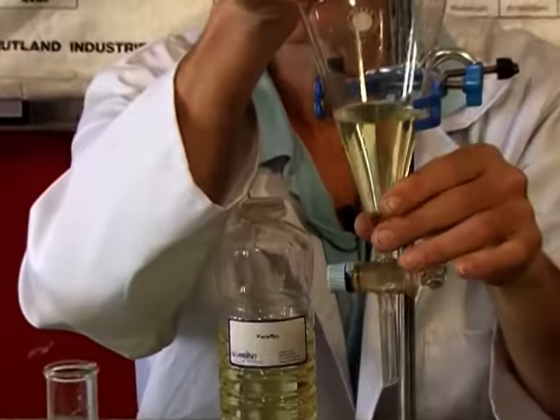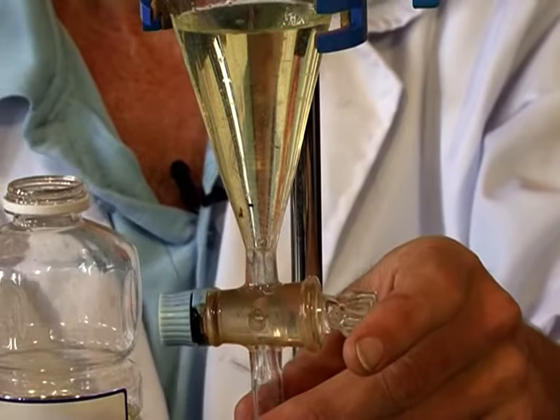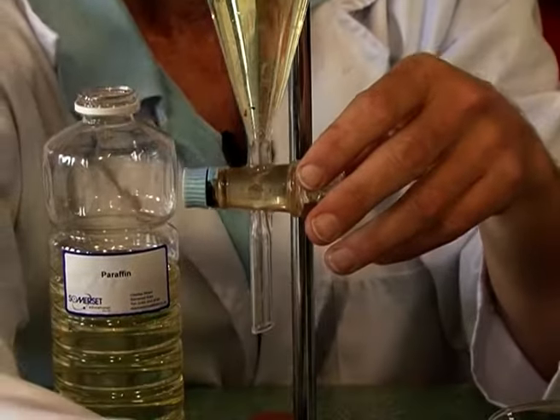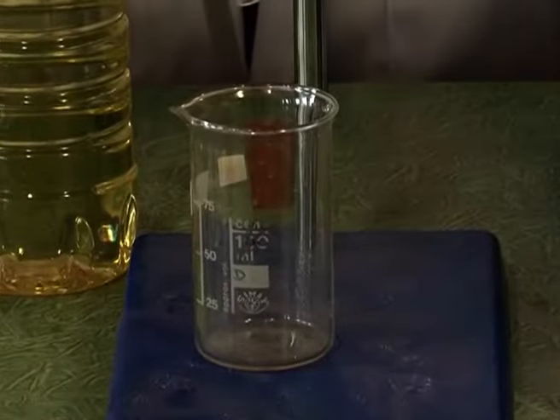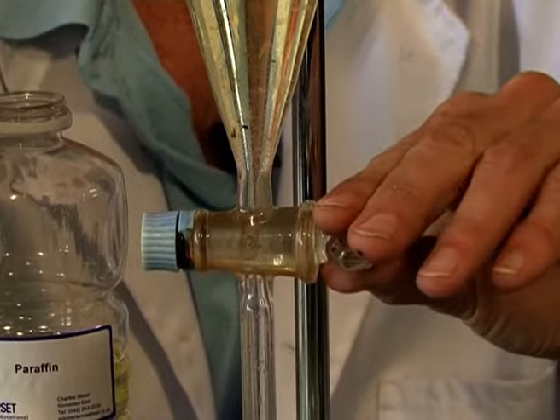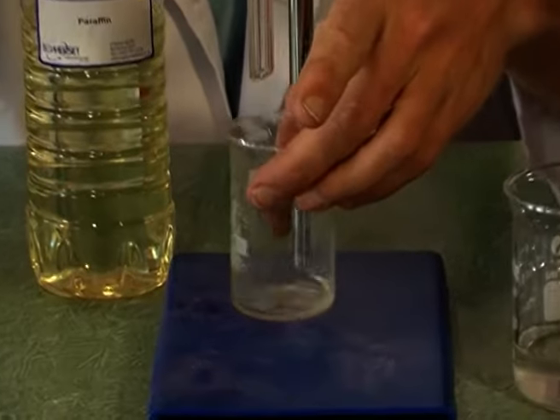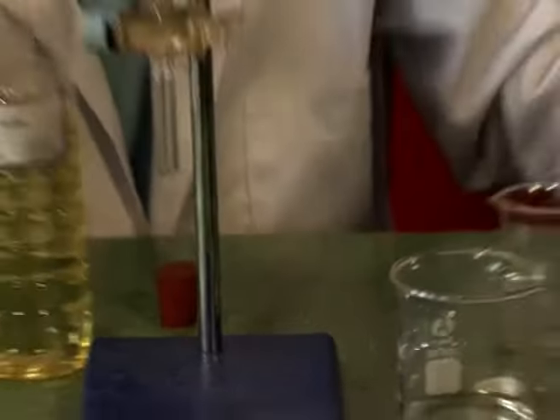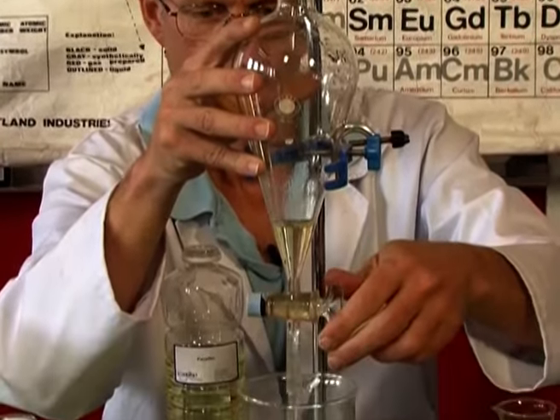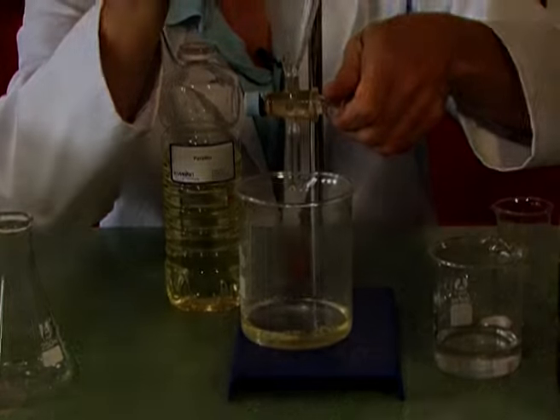We've still got a bit of a mixture at the bottom. So I might even collect a fraction that I don't keep. I might, for example, use a smaller container, collect a little bit that catches the water and the paraffin. That is still a bit of a mixture. You might be able to see some of that emulsion there. And then I'm able to now collect my paraffin separately. A separating funnel. Simple and easy to use.